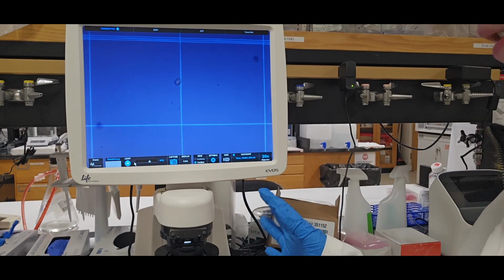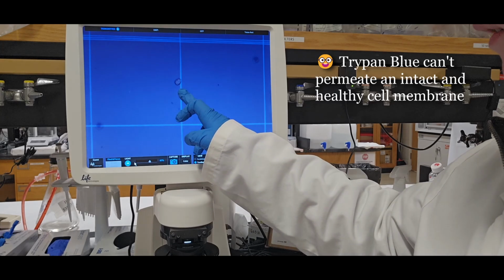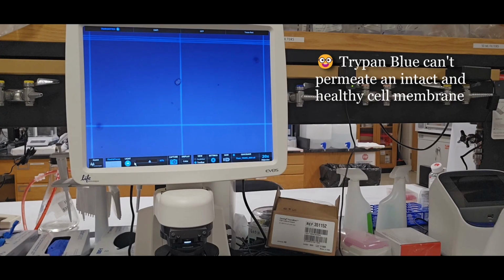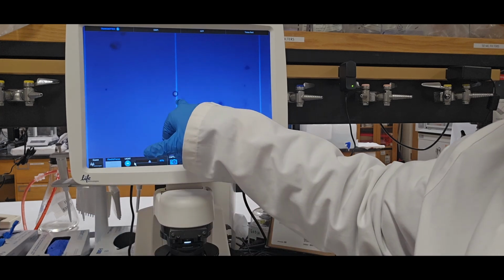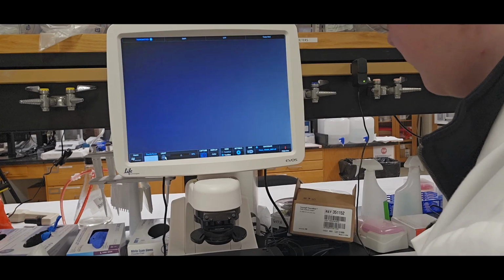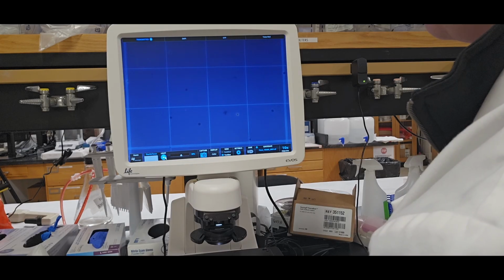But how Trypan Blue works is that it dyes the background blue, and any living cells are going to be this yellow color here. Any dead cells will not be as bright as the living cells. And you would only count the really bright yellow cells like those. So once I find that top left part of the hemocytometer, I focus my microscope, and I am only counting cells that are glowing.